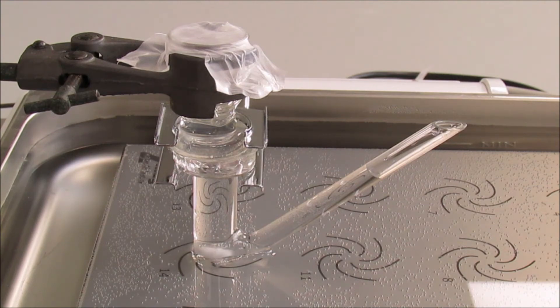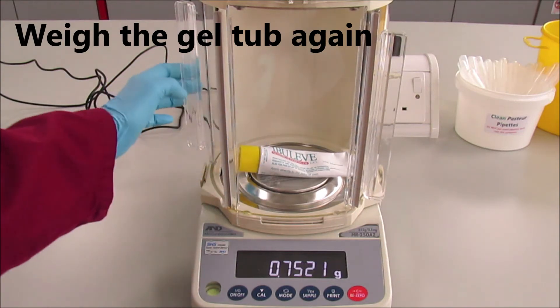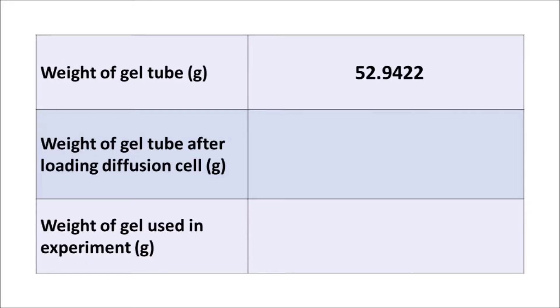Now we are measuring the gel tube after discharging the gel, and we could work out what amount of gel we placed into the cell by the difference.